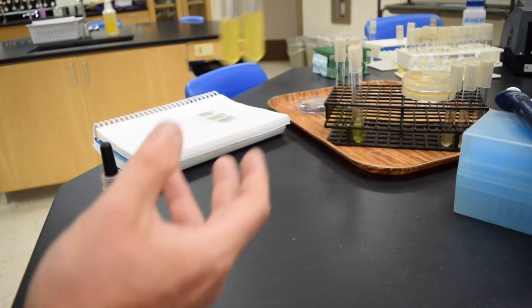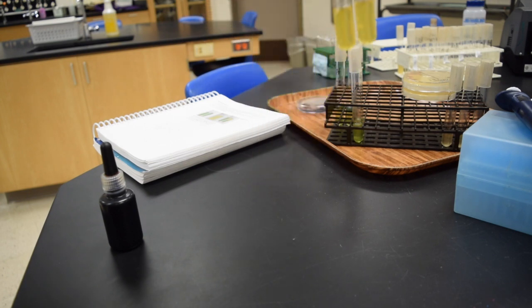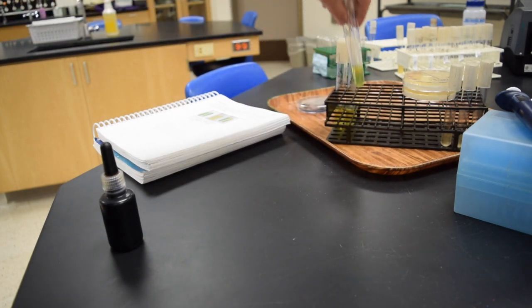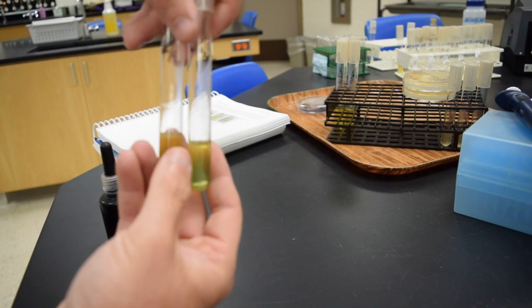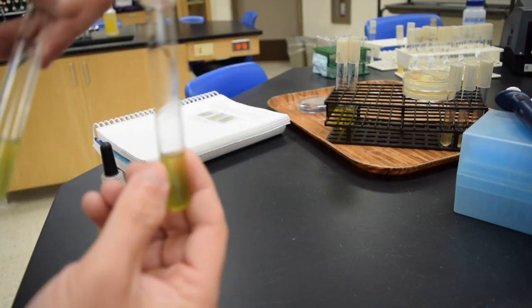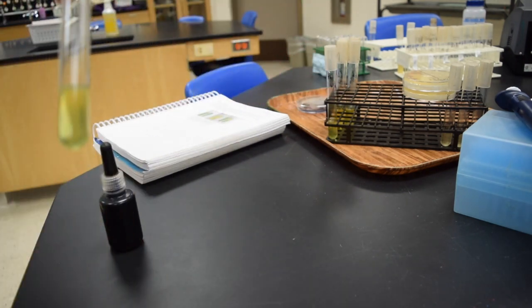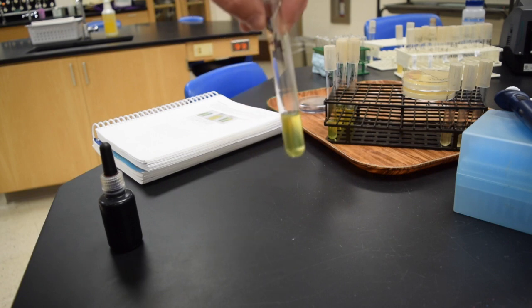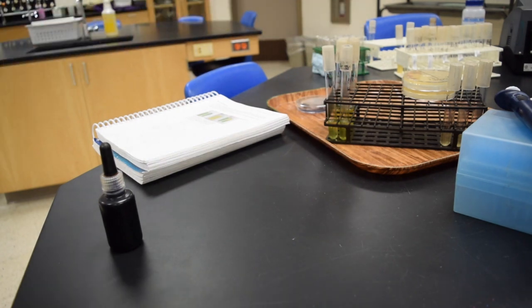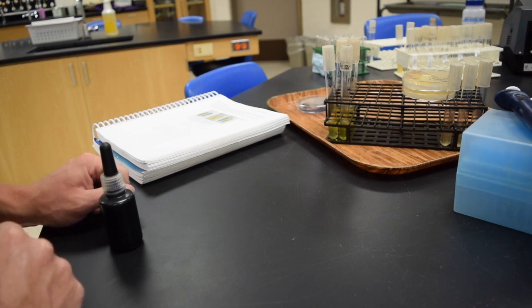Here we have E. coli, with and without oxygen. Both of those are now yellow. So that indicates what type of metabolism that organism is using. And then with oxygen, Pseudomonas aeruginosa, the media is kind of yellow. Again, it's hard to tell with this picture here, but without oxygen, it is still a green color. Again, I'll take stills of that. So Pseudomonas with oxygen is yellow. Without oxygen, the tube is still green.